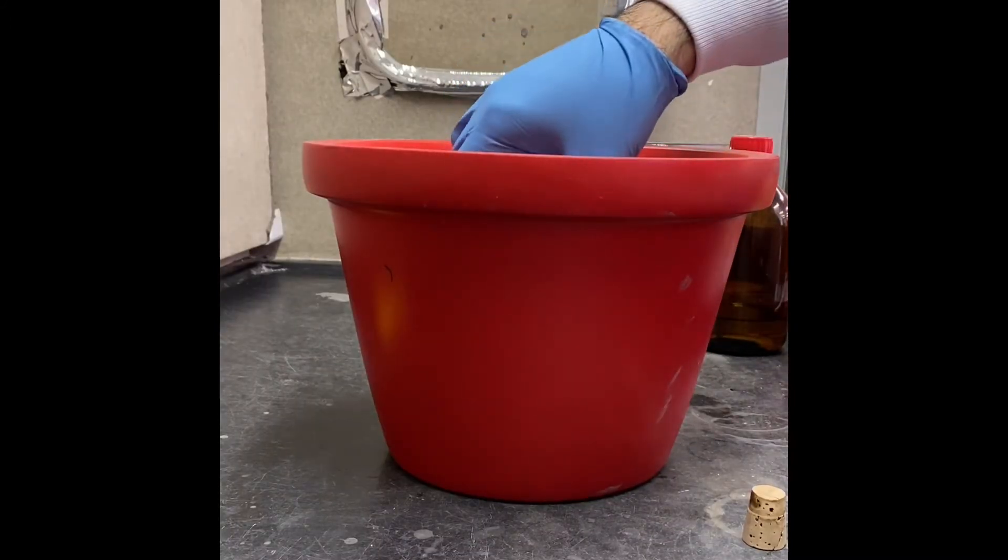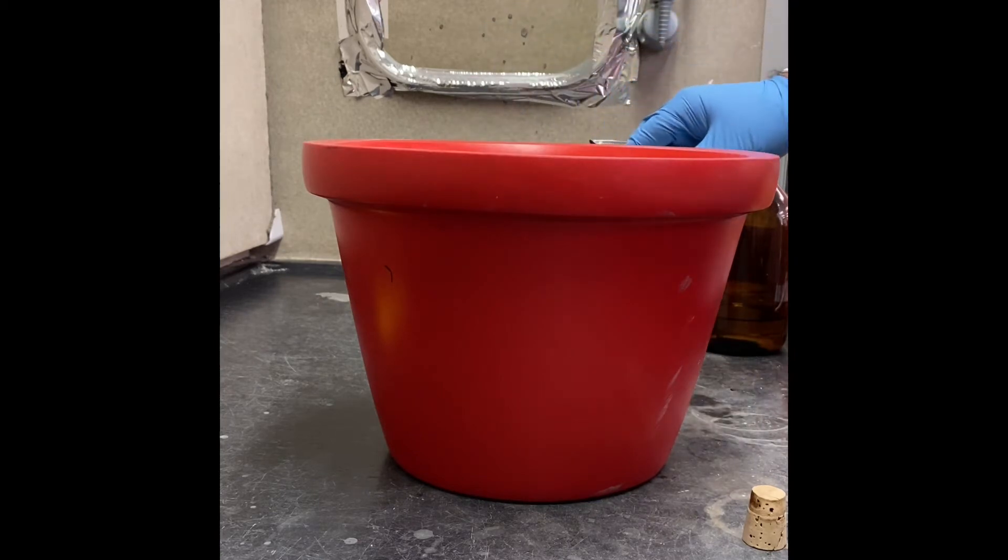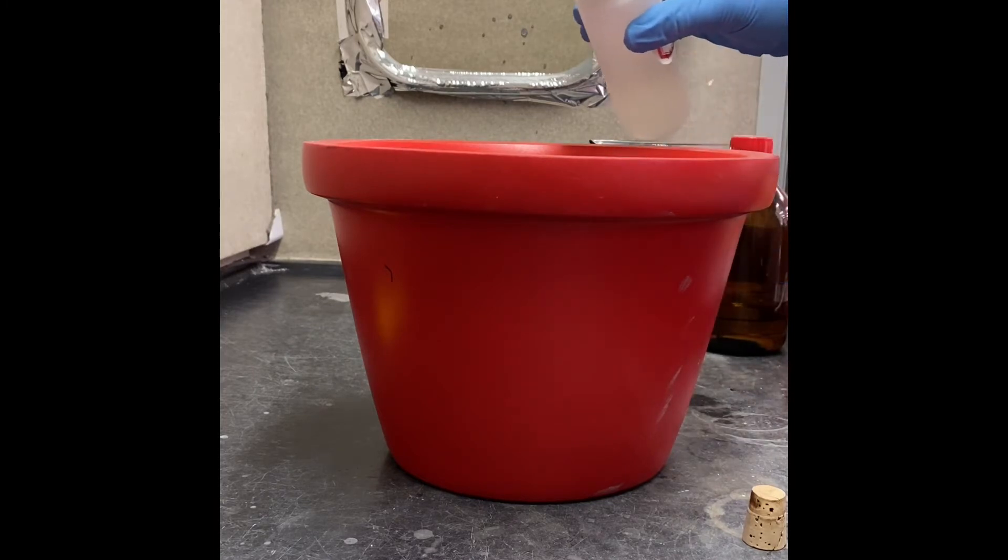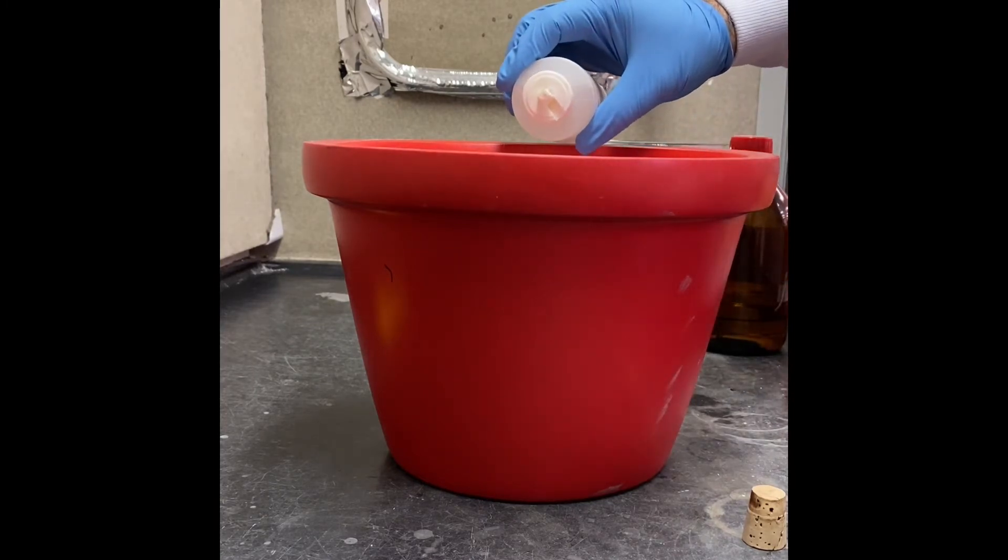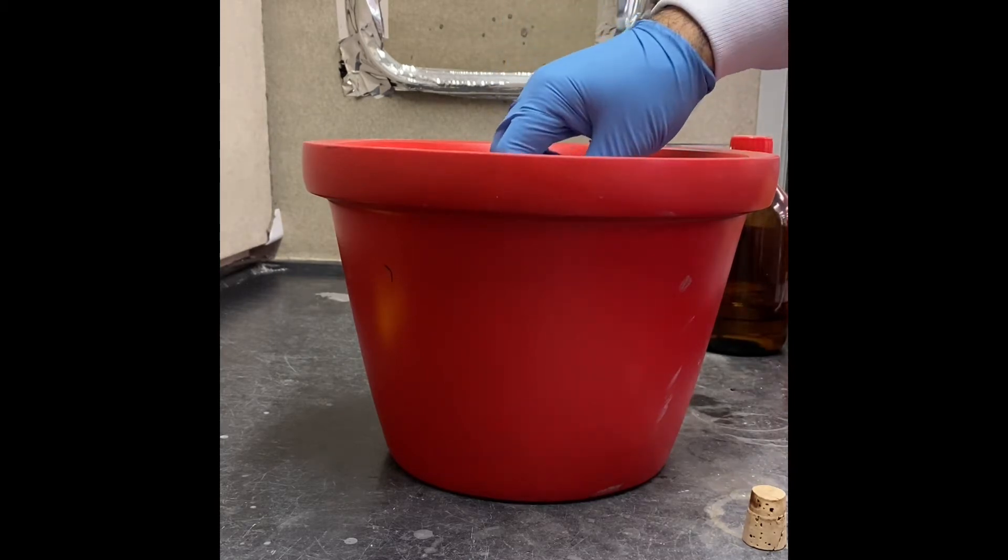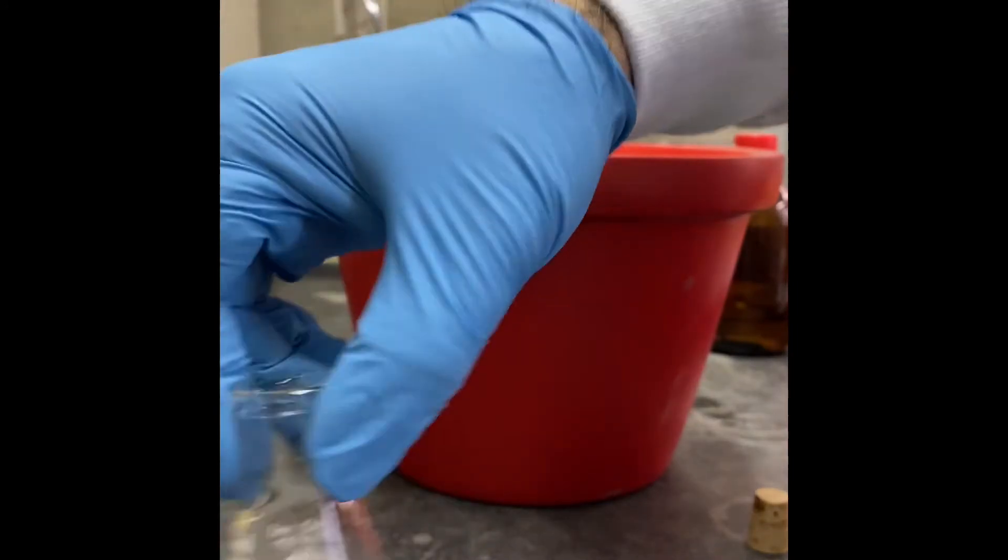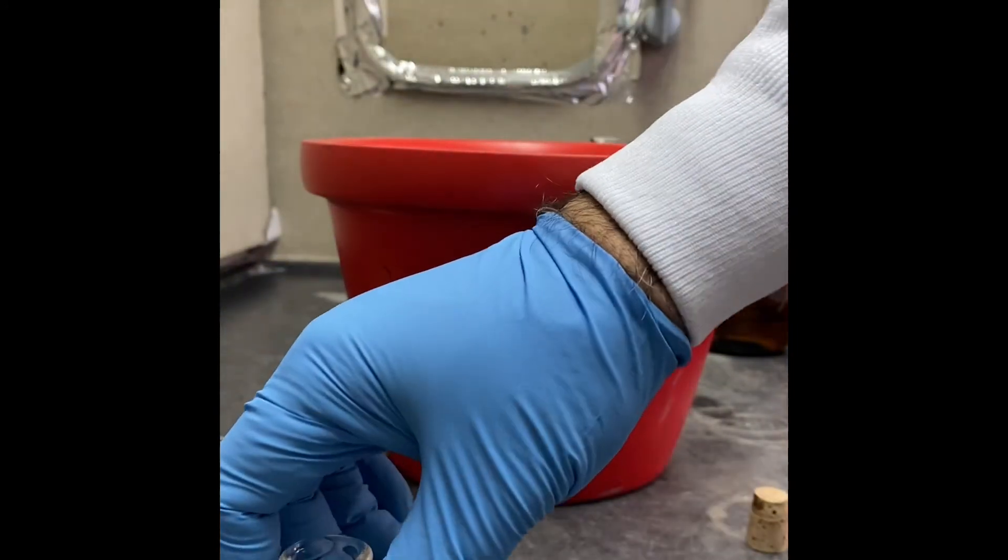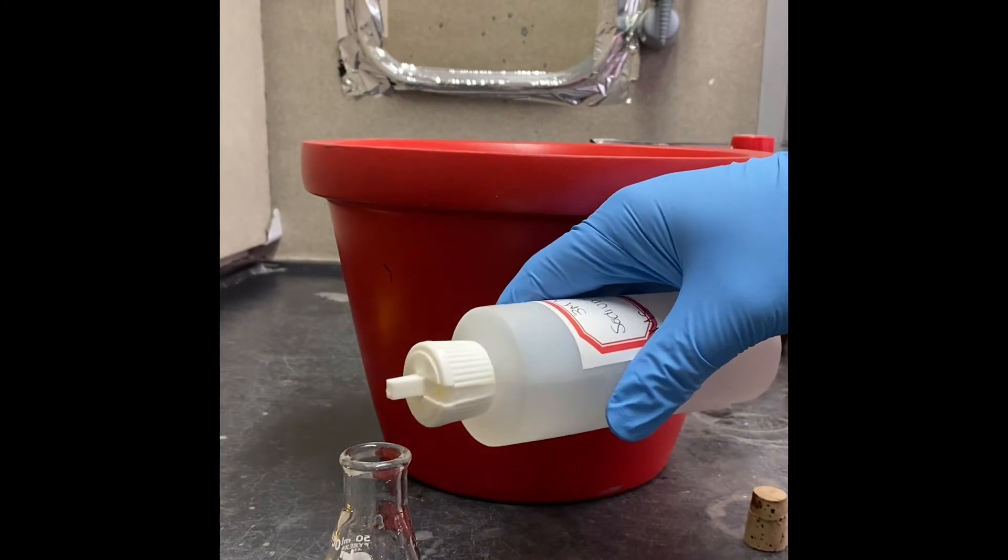I will add 2.5 milliliters of 3 molar sodium hydroxide drop by drop. I'm going to show you when I'm adding the sodium hydroxide.